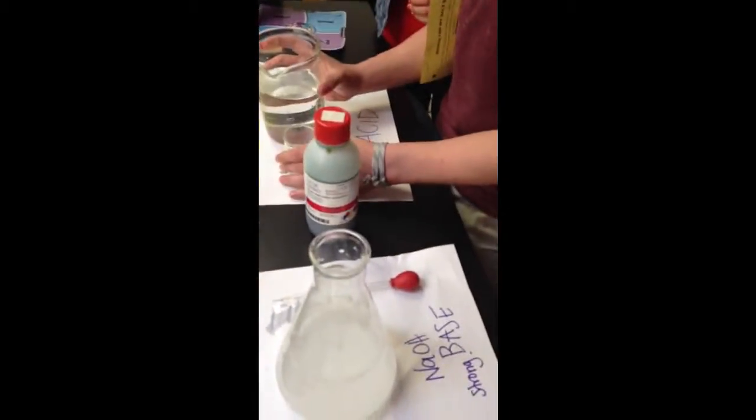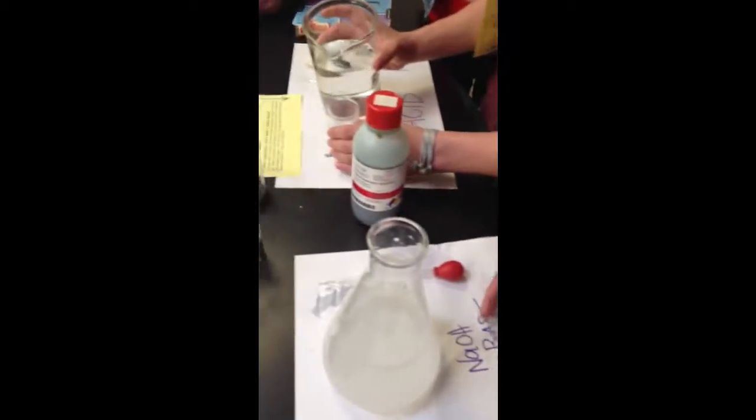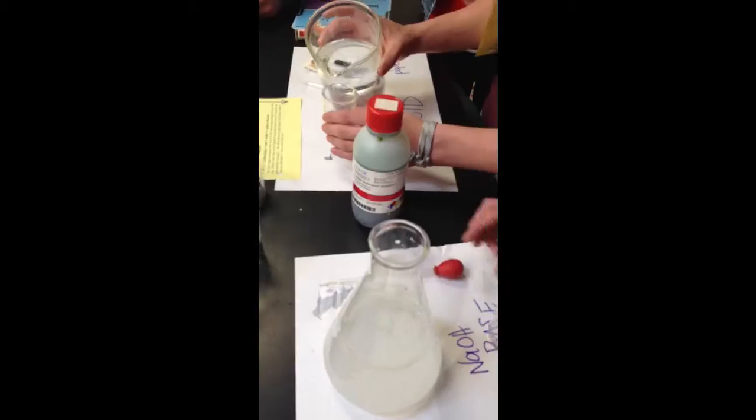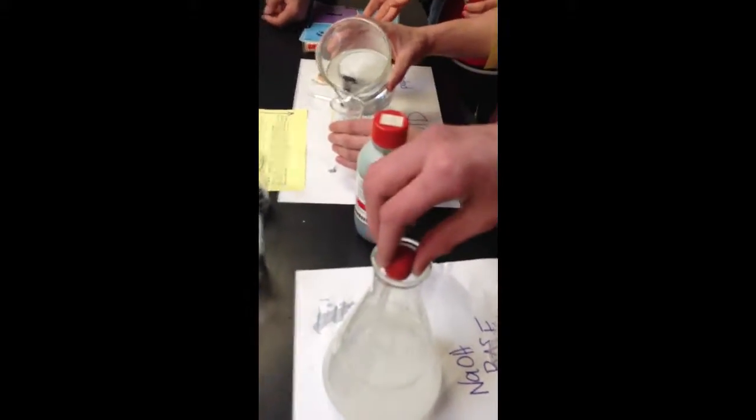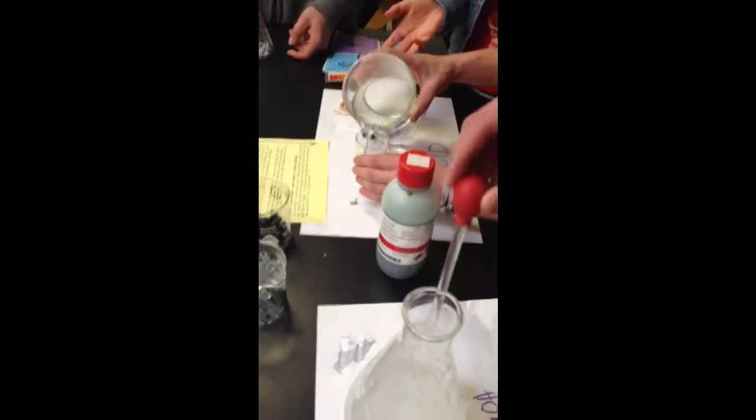Just don't get it on your hands. Oh, is it going to burn? It's acid. Just do it. Just pour it. Sweet baby Jesus. Okay.